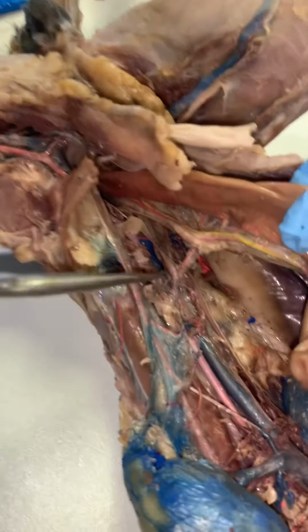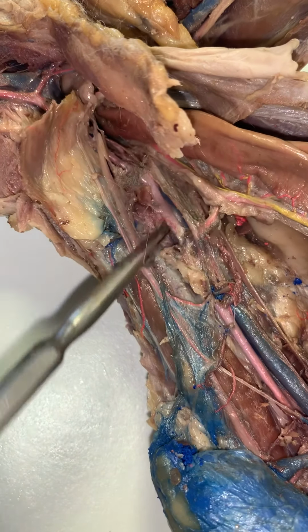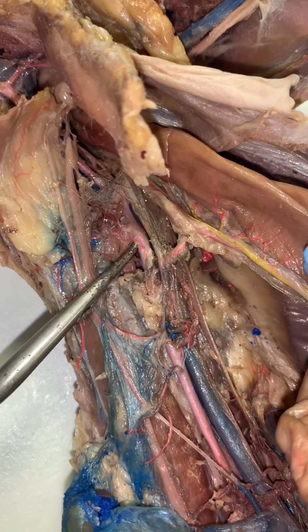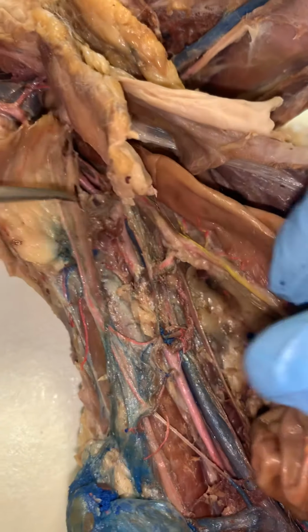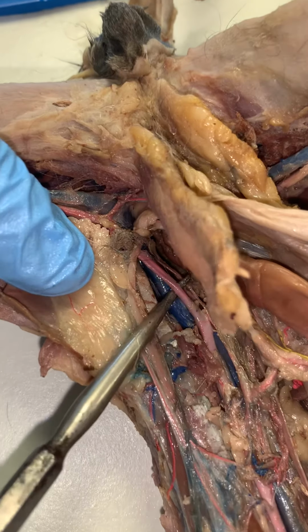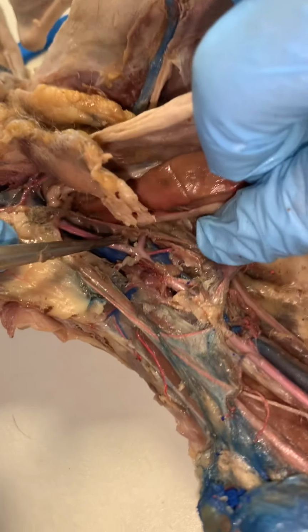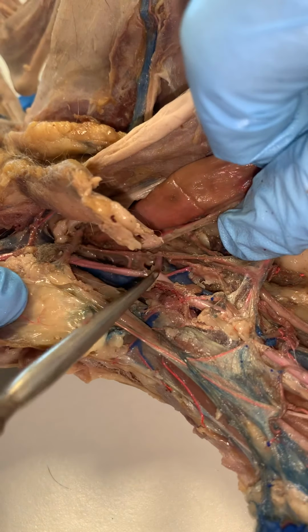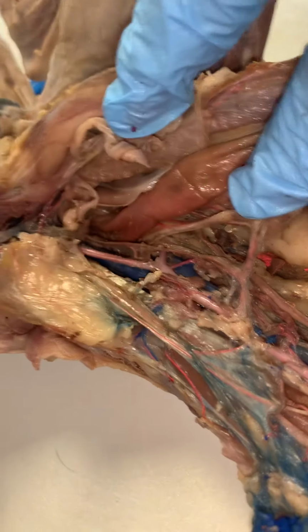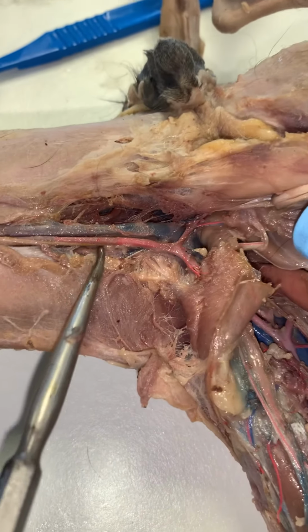Now we're going to pick this up. Down here, there's my abdominal aorta. We're going to keep on coming down, and it's going to split on us. Here's a split on the left-hand side, and there's a split over on the right-hand side. You can see it. This is called the external iliac. As it comes down and passes through the abdominal wall, there it is, it then becomes the femoral.